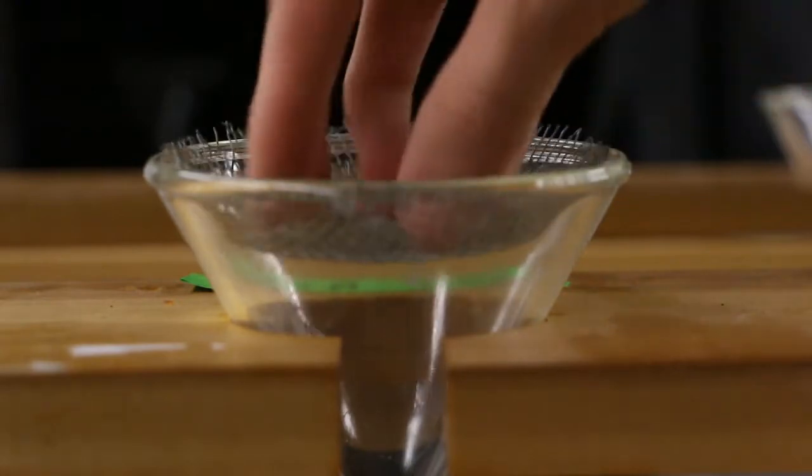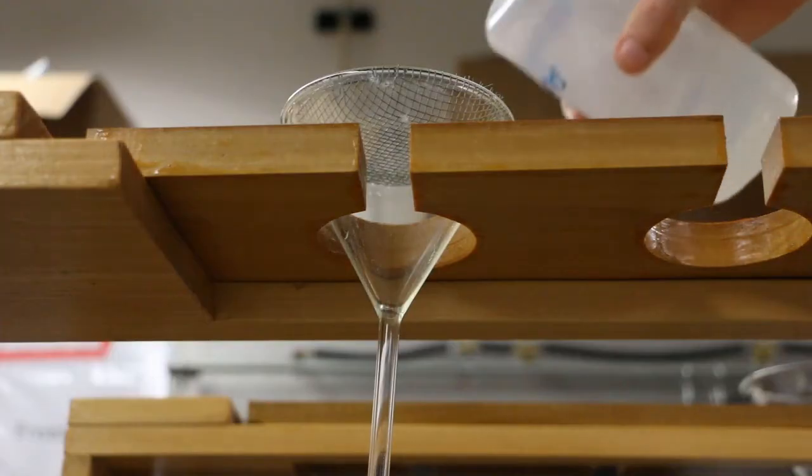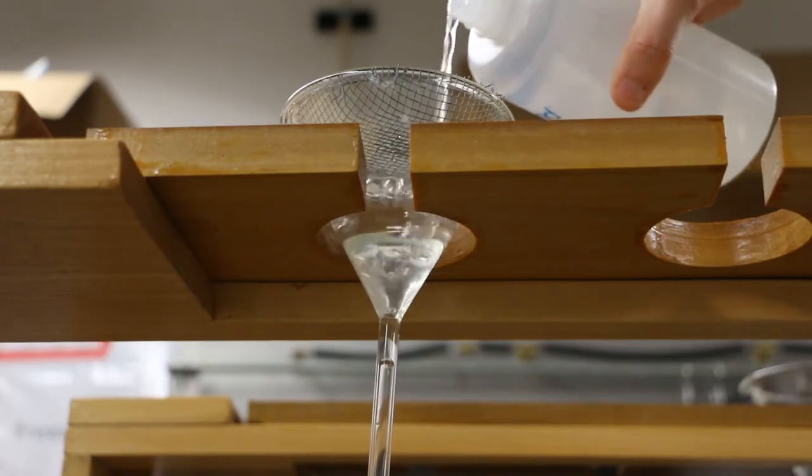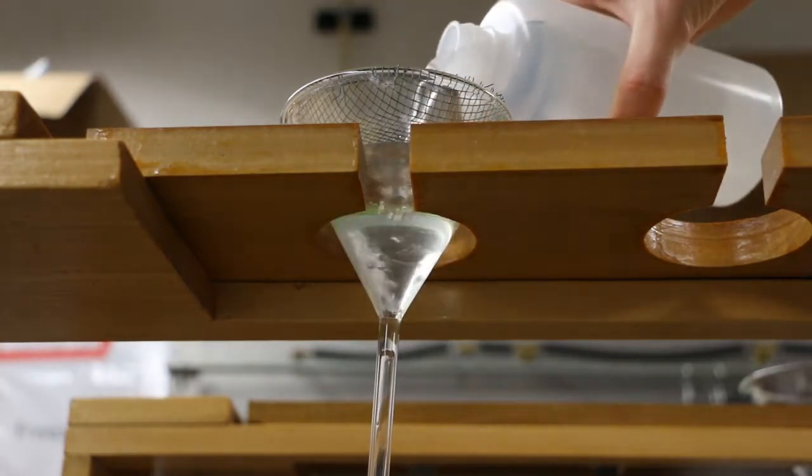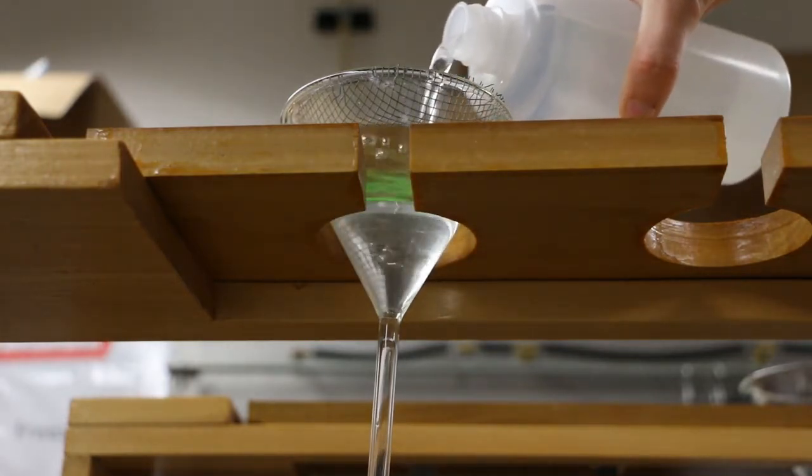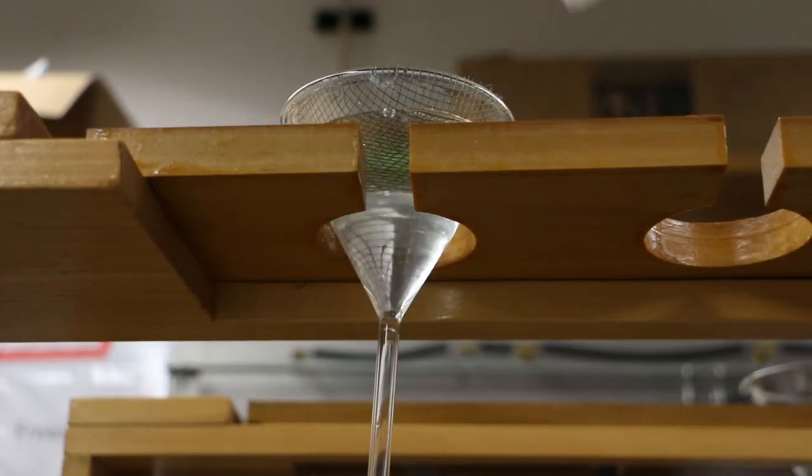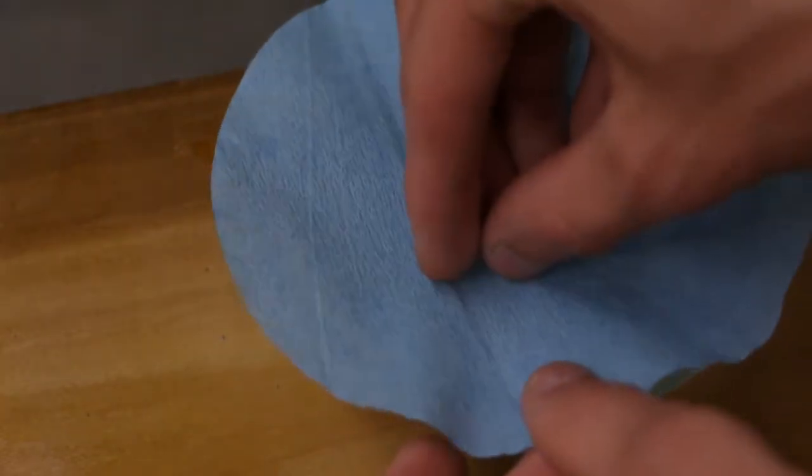The wire mesh will hold your soil. You'll want to fill it up so that some of the soil gets wet. As this absorbed moisture evaporates overnight, any nematodes in the sample will crawl down the soil column to stay within the water-filled pore spaces, until they reach the filter paper, crawl through, and sink into the trap.